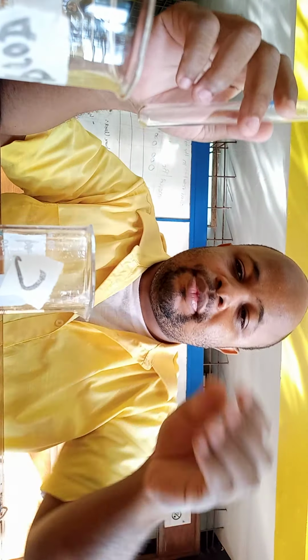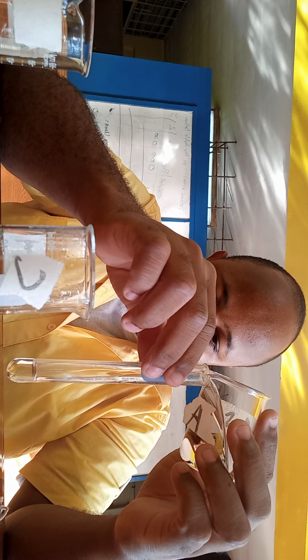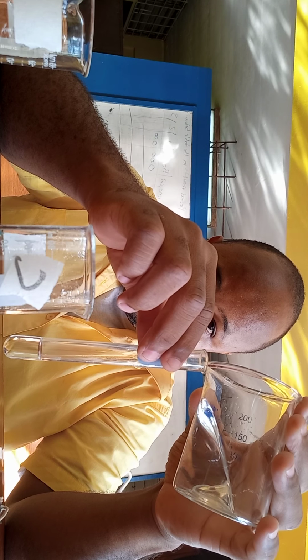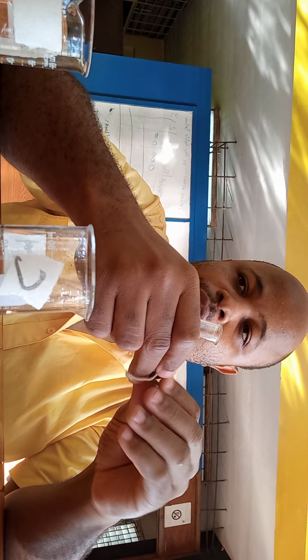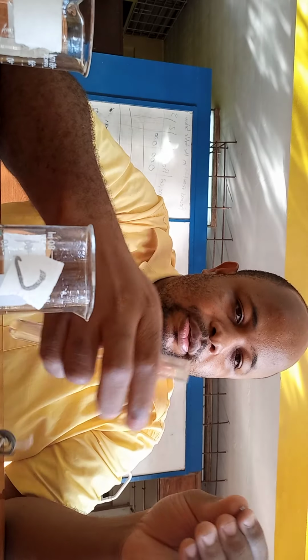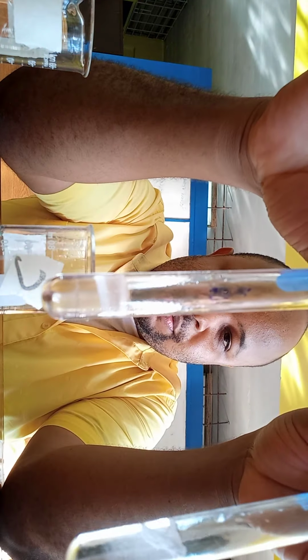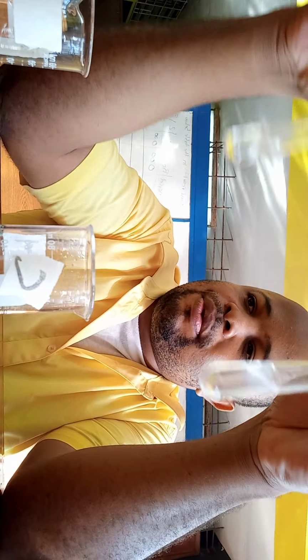Just a second. So this is an experiment. We can do it. Alright, so let me pour some of the alcohol in this test tube. Alright, and then add the acid. Alright, and let's place a piece of magnesium in it. Notice which container reacted the same, like this one. Where were they?